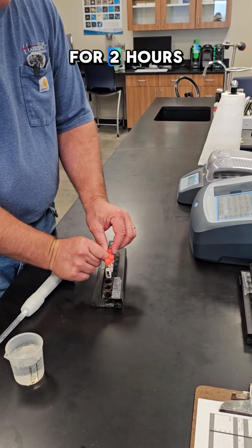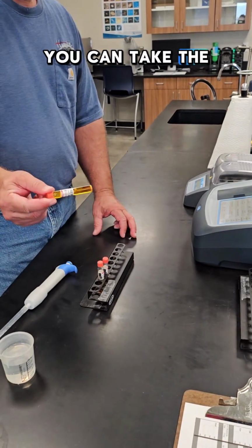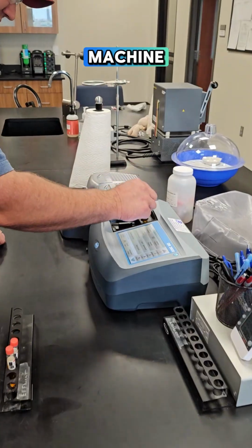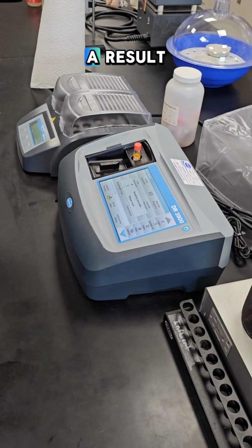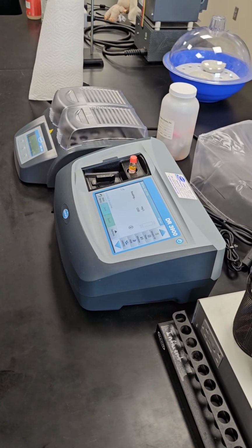You set a timer for 2 hours, and then after 2 hours, you take the vial and put it in this machine, and it automatically reads the barcode, sends light through, and gives us a result.